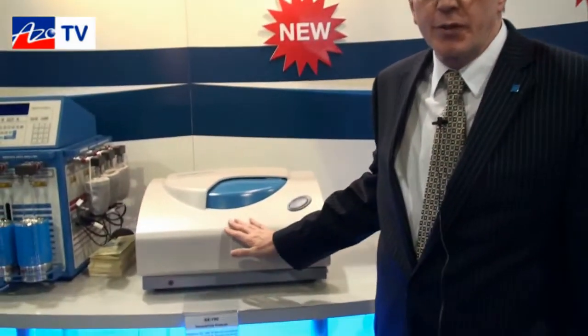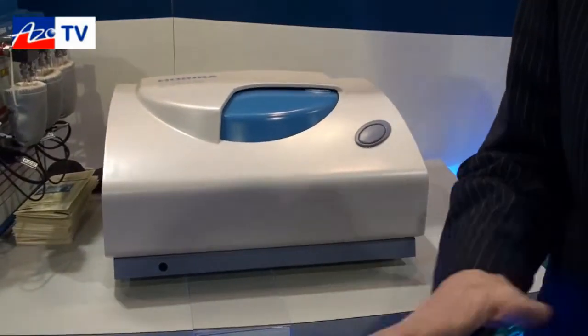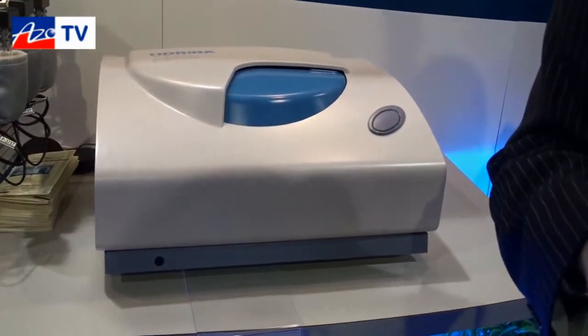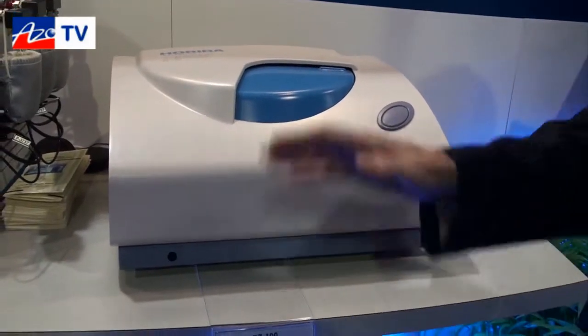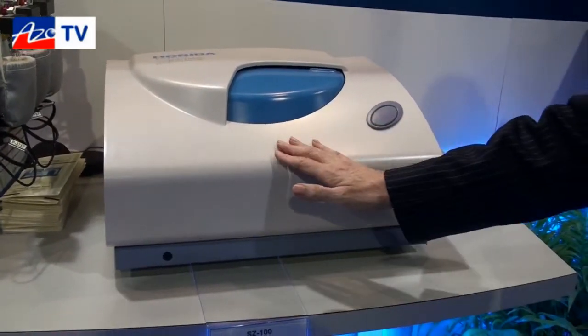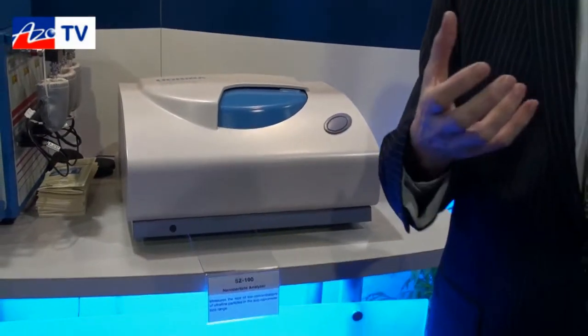Thank you Cameron. The instrument we have here today is our newest instrument to measure small particles. Think of this as the technique to use when all of the particles in your sample are below a micron. This is based on dynamic light scattering — we look at the light scattering due to the Brownian motion of the particles, and from that we can calculate the particle size. It has an effective dynamic range of a little under a nanometer to a little above a micron.